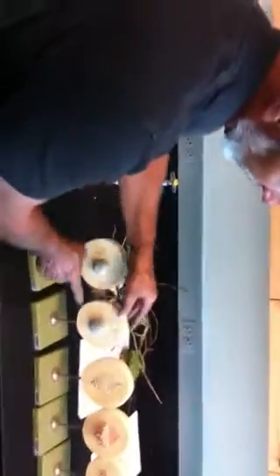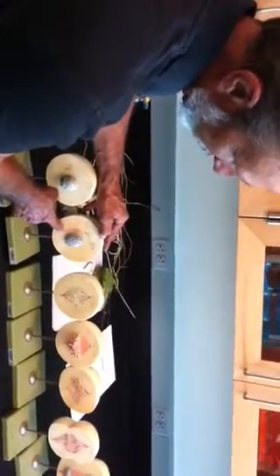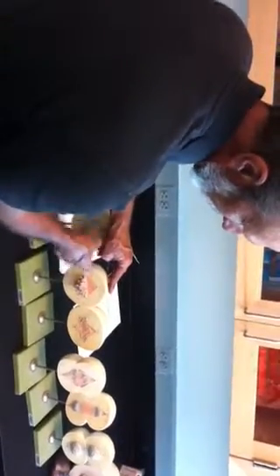And over here, this is animal cells in mitosis. This is actually interphase. I wouldn't ask it, but you can tell because the nucleolus is still there. This is prophase. You can tell that because the centrosomes are migrating to the poles. This is prometaphase. I'm not going to ask this one. This one would be metaphase, or lined up on that equatorial plate.